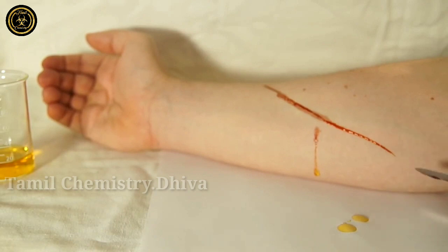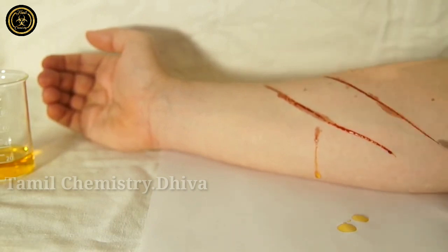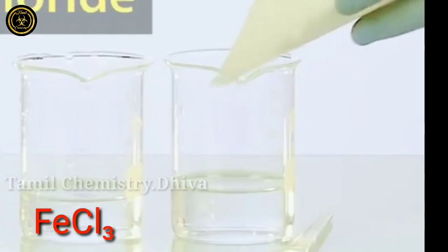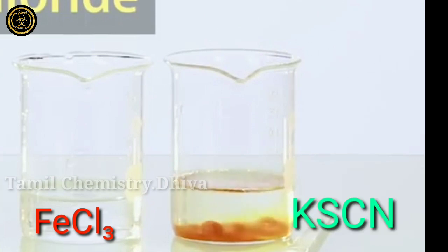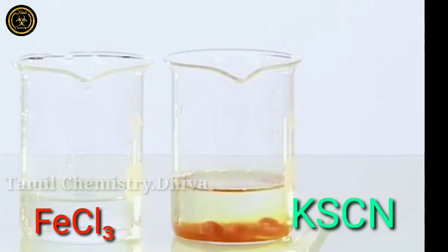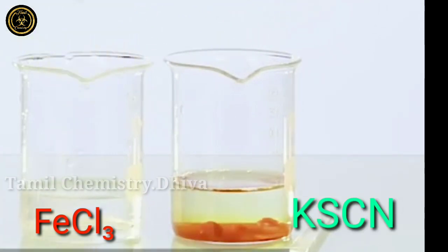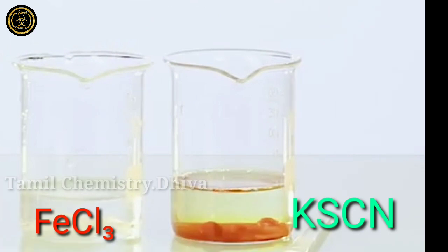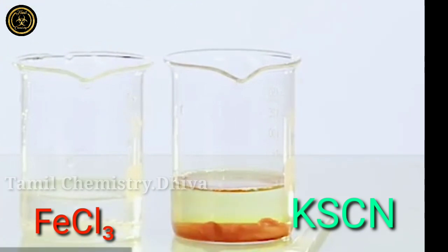This is the main chemical component of this experiment: ferric chloride and potassium thiocyanate. The molecular formula for ferric chloride is FeCl3, and the potassium thiocyanate formula is KSCN.